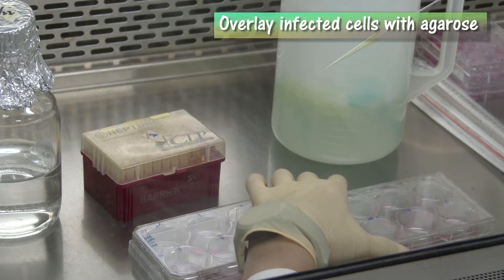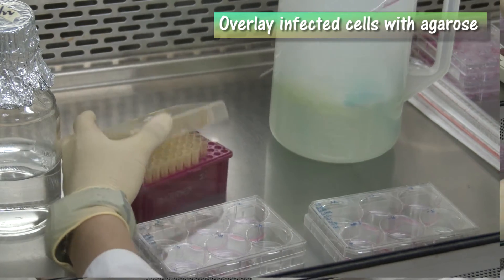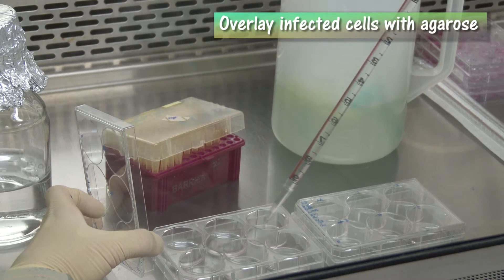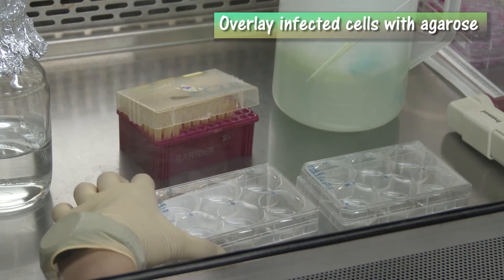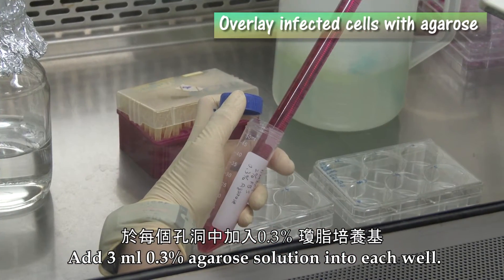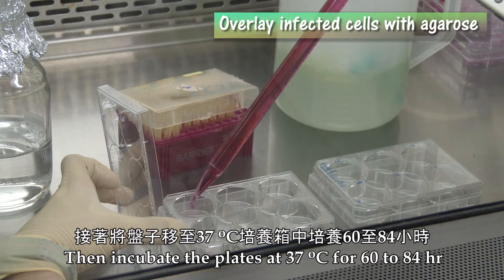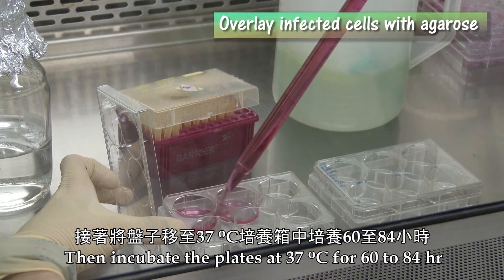Discard medium from each well, mix well, and wash cells with 500 microliters PBS. Add 3 ml of 0.3% agarose solution into each well. Keep the plates at room temperature until the agarose overlay solidifies, then incubate the plates at 37 degrees Celsius for 60 to 84 hours.